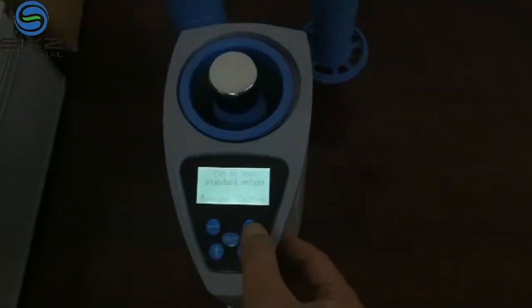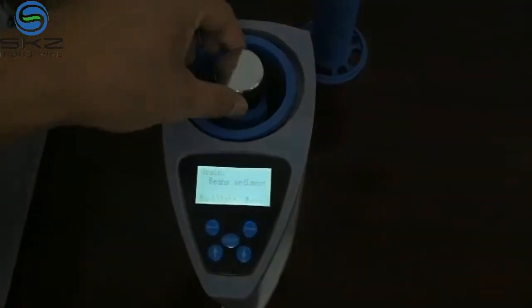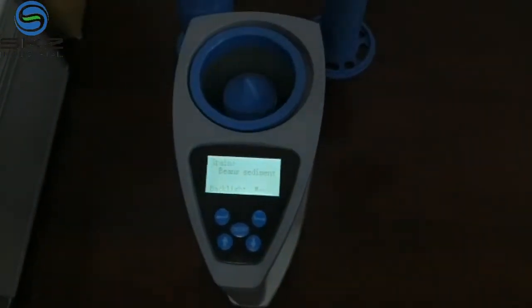Then press confirm. Now it's okay. Calibration finished.